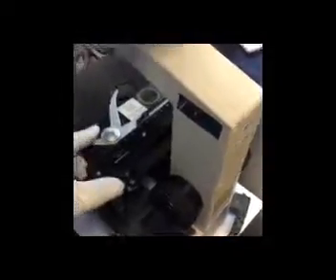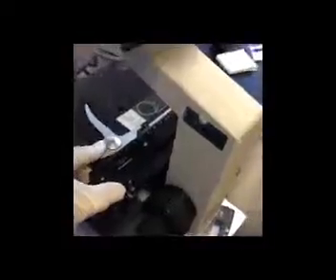So I've just slid my slide into slide clips, and we want to remember to release the slide clip gently. Otherwise, if you release it quickly, the clip could actually smack into the glass slide and break it. Now, this is a prepared slide of Spirogyra, a photosynthetic eukaryotic microbe, and it has a really thick cover slip on it. We can see it's a circular cover slip.